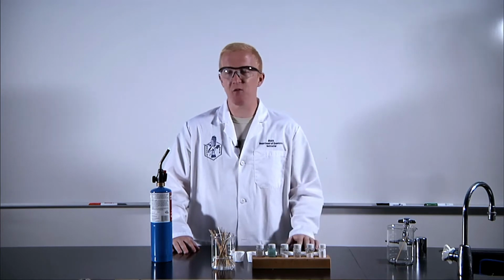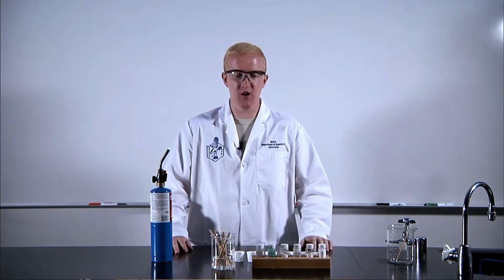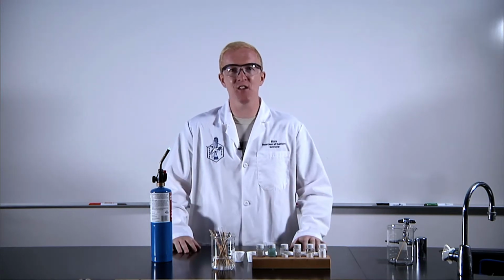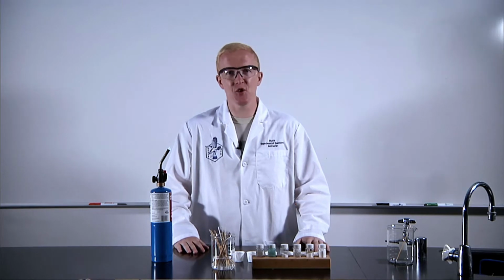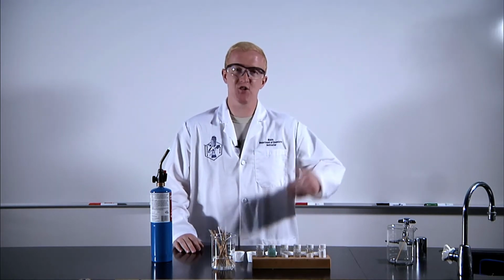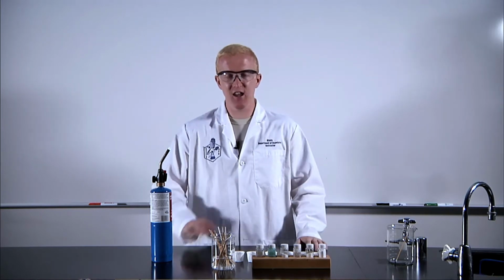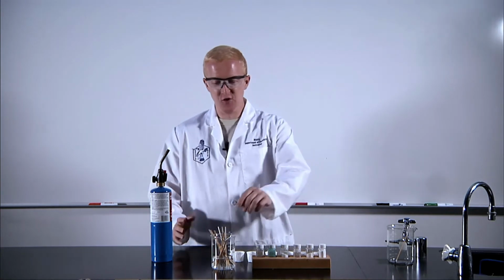And what's really interesting, when we add energy to that metal with this propane torch here, you're going to see unique colors inherent to that metal. Ultimately, that is inherent to the energy level transitions. Once those transitions occur, we relax that electron, it emits a photon, and we see a color. So without further ado, let's look at a few of these.